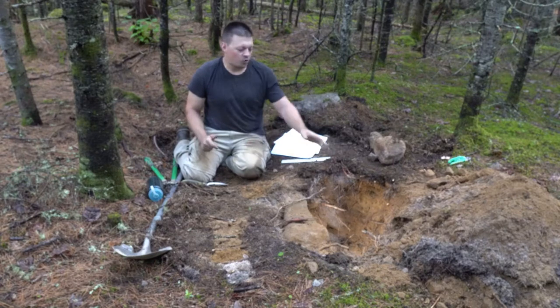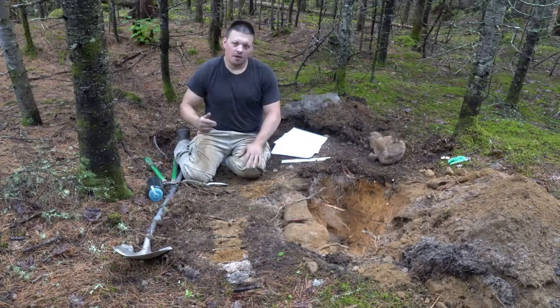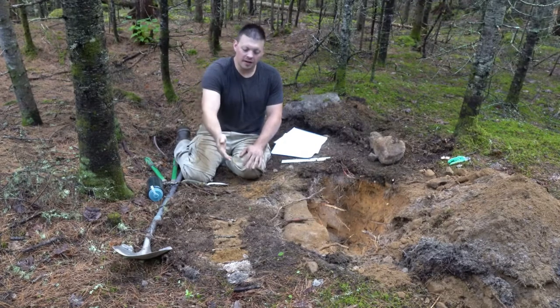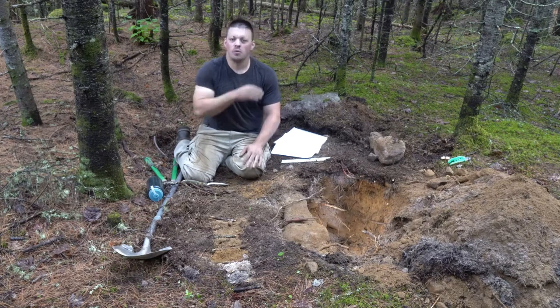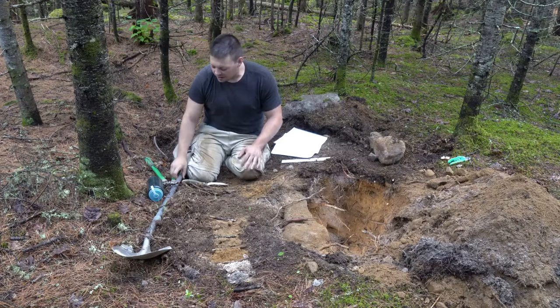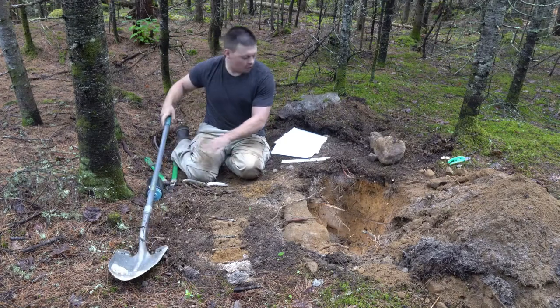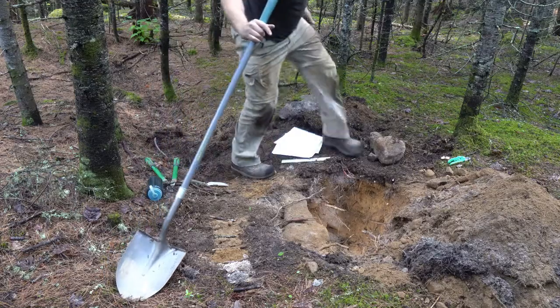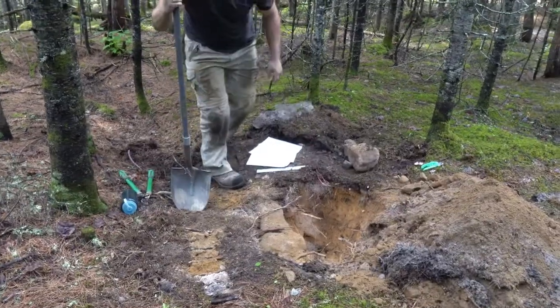So in the lab, when you have your soil profile dug, myself or TAs will come around, or an instructor will come around, and they will collect soil samples. These soil samples are what we will use in the field or in the lab to identify some of the physical and chemical properties of each horizon. Once that is said and done, we make sure we have all of our tools accounted for, and then we simply fill in our pit.